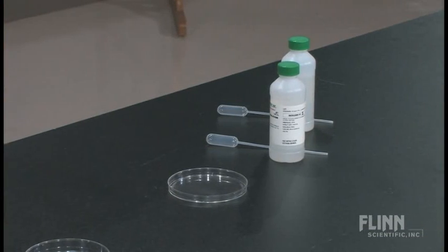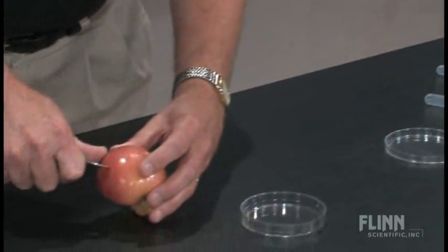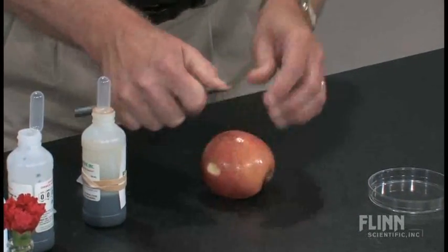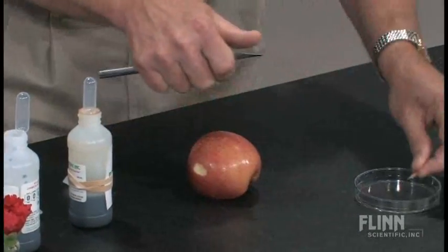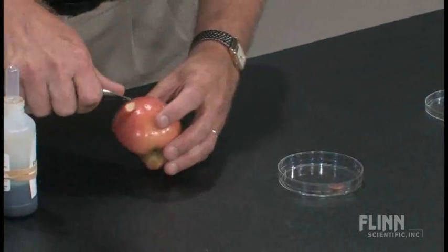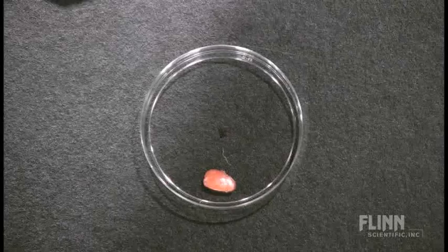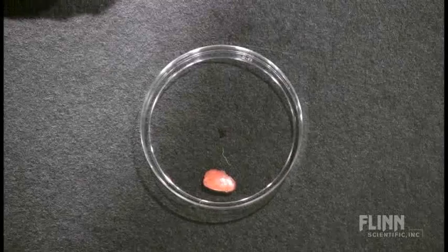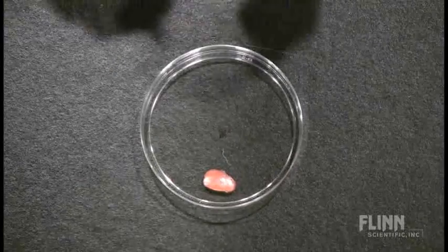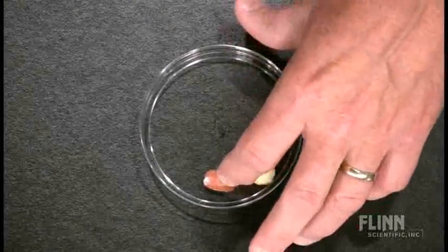For example, we're going to take a small piece of apple — I want a small piece of the apple skin so that we can see that nice red color. And then we're also going to take a piece of the apple flesh so that we can see that nice white part that we enjoy eating. We're going to place those around the perimeter of the plate.